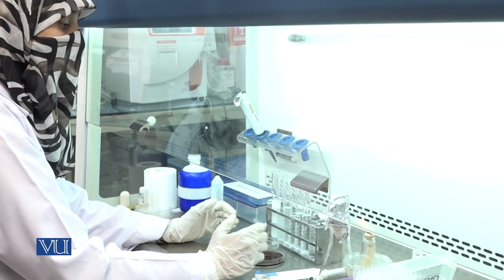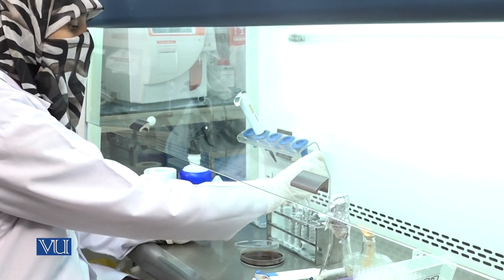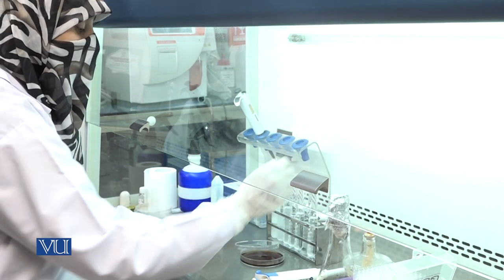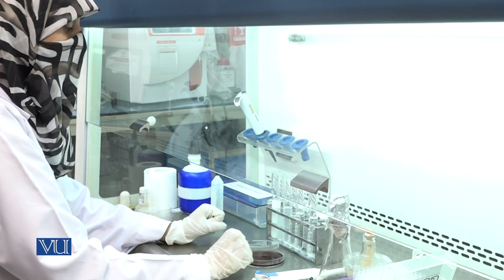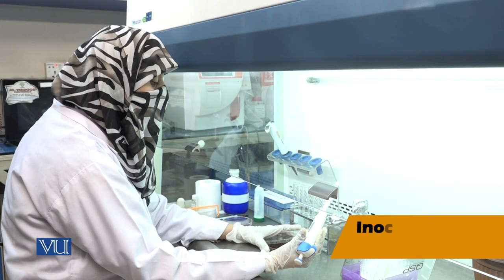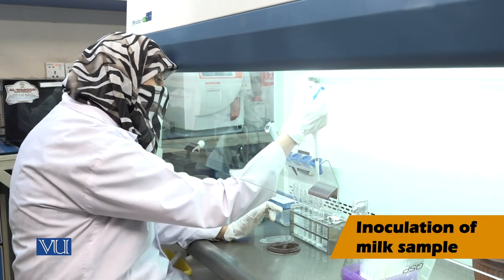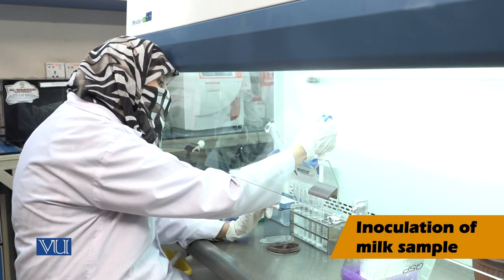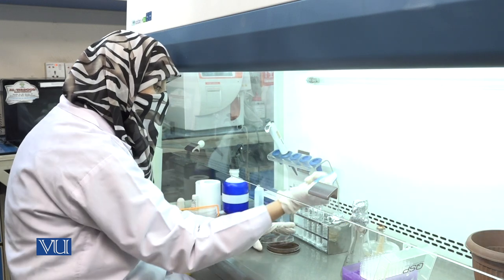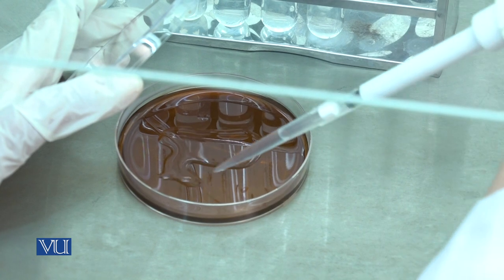As the agar is solidified, we use the 10 to the power of minus 6 dilution for inoculation of the milk sample. Now take 1 ml from the 10^-6 dilution and pour it on the surface of the agar.